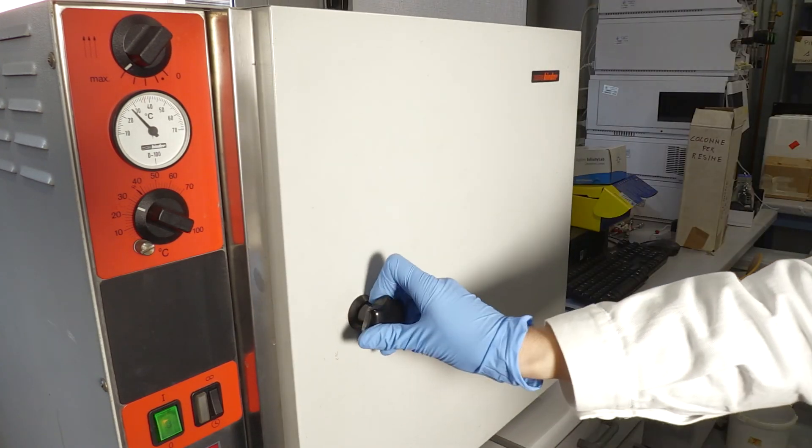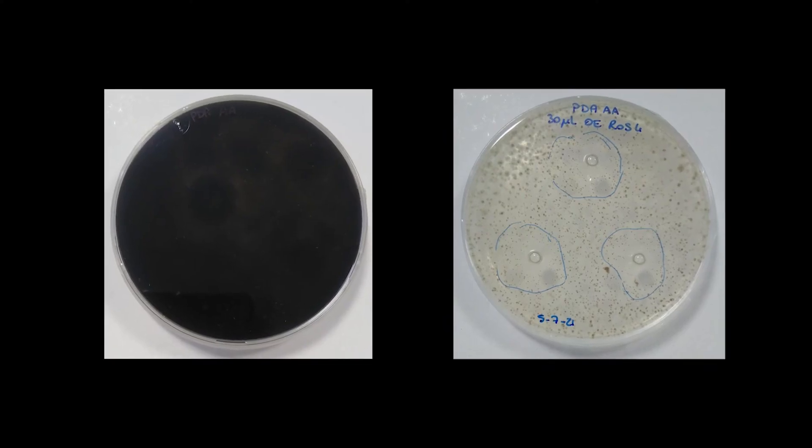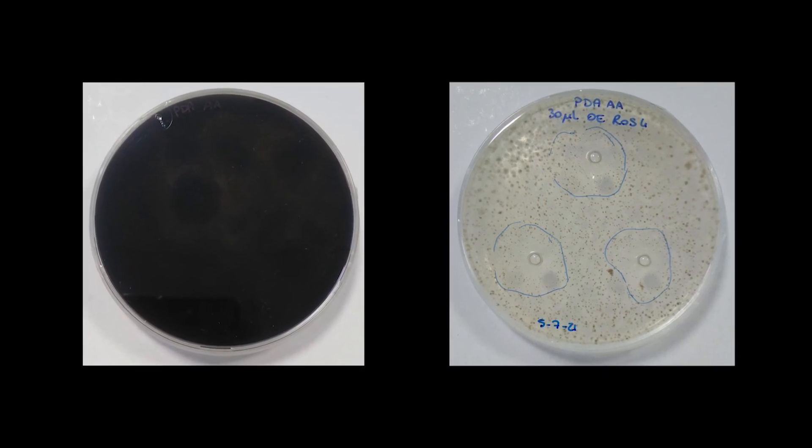After proper incubation, the fungus growth appears strongly inhibited from the treatment with rosemary essential oil.